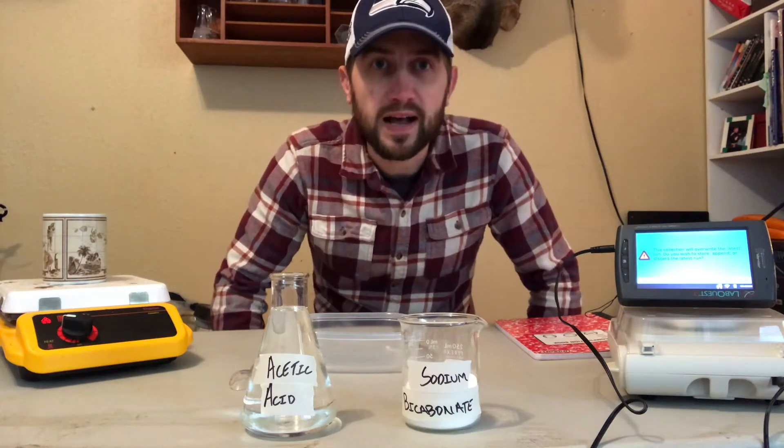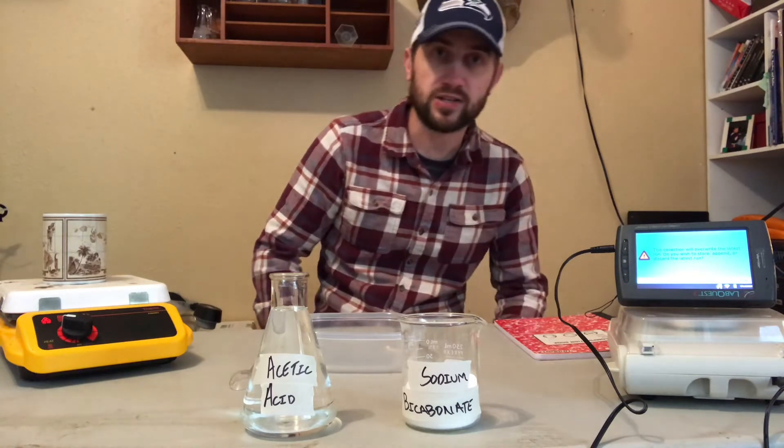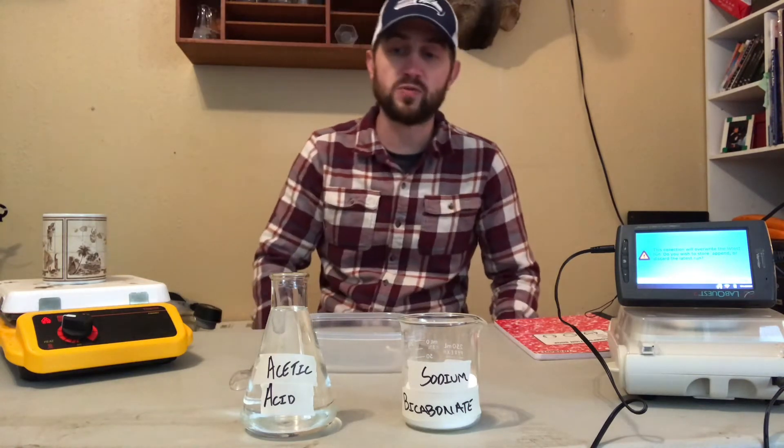Well hello scientists, here we are. I want to show you a couple of chemical reactions — these are labs that we would typically have done during class. Unfortunately we're not in class together, so I want to show you what these labs would look like and kind of explain a few things that will go along with the notes on chemical reactions, equations, and balancing chemical equations that we'll get into next week.